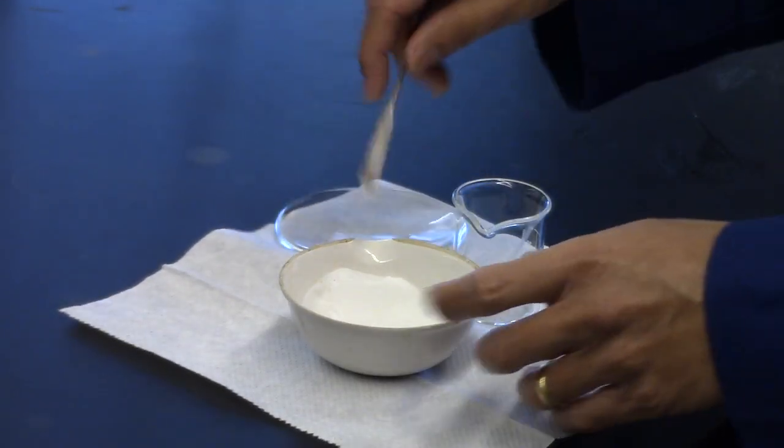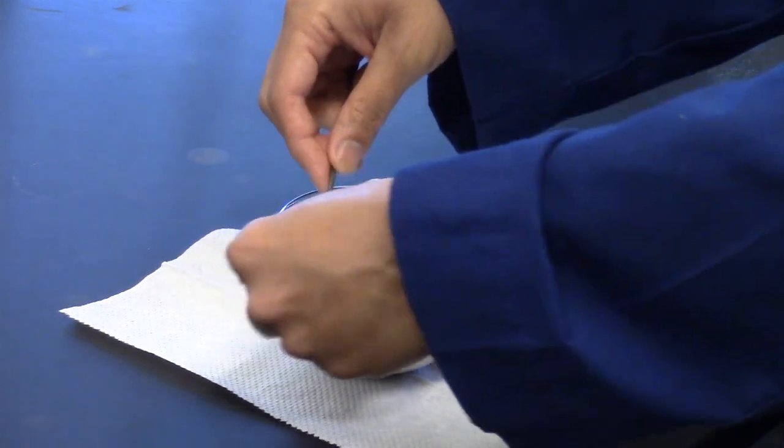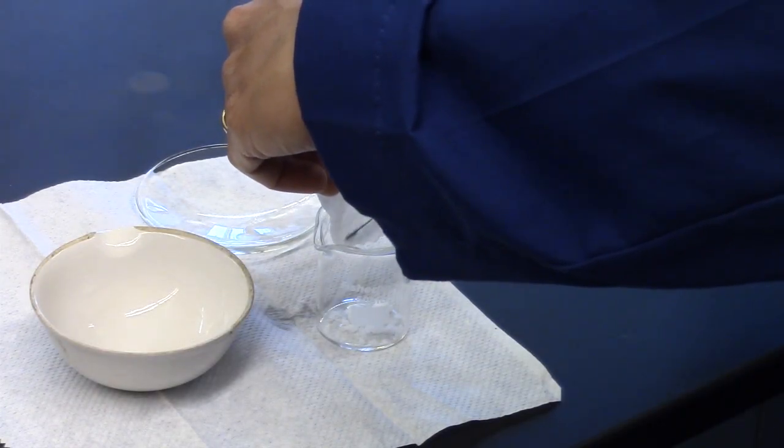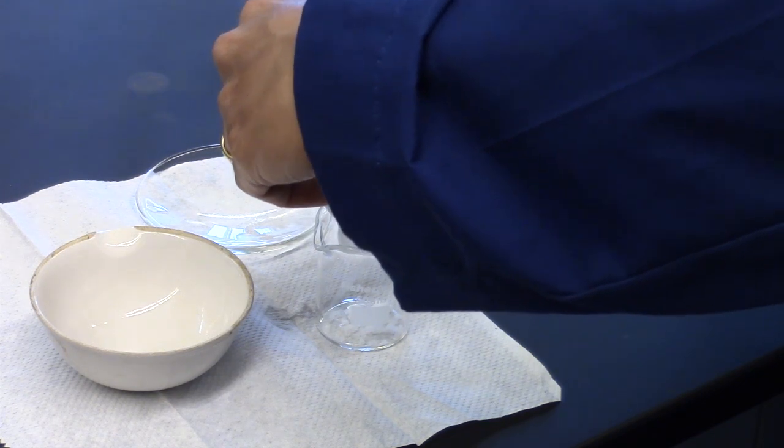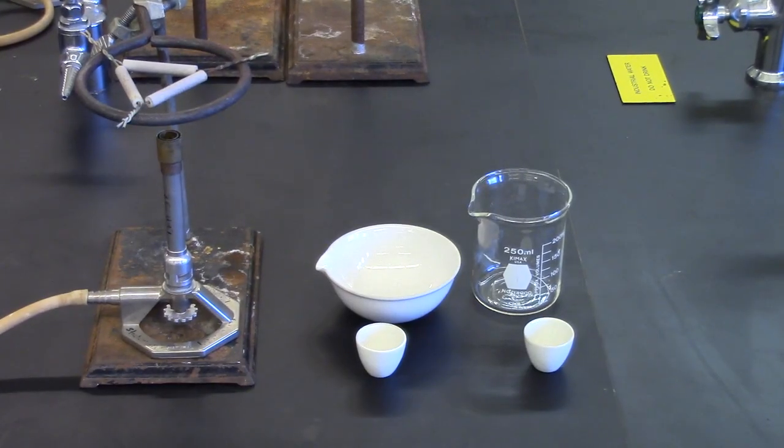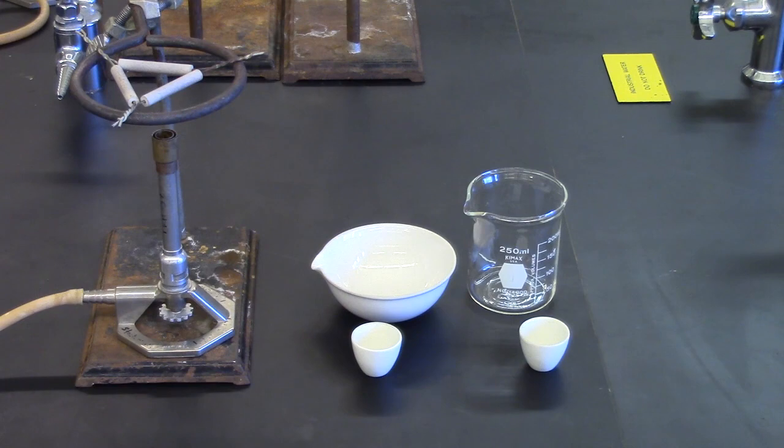Retrieve the synthesized sodium hydrogen carbonate from your locker. Scrape the product from the filter paper to a beaker. You will need one sample for part B, and two samples for part C. You will need two crucibles, crucible tongs, a clay triangle, iron ring, ring stand, and Bunsen burner to clean crucibles.